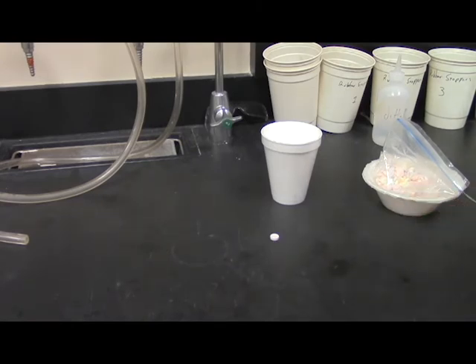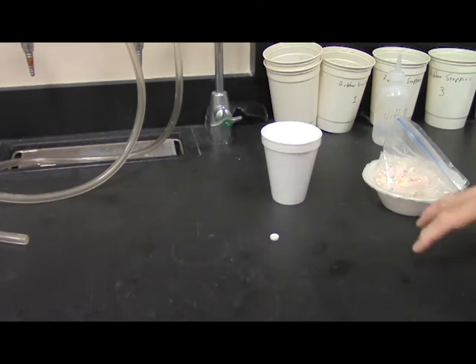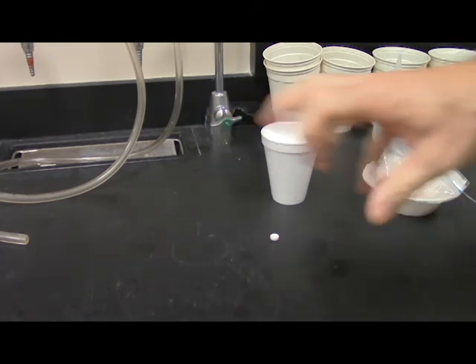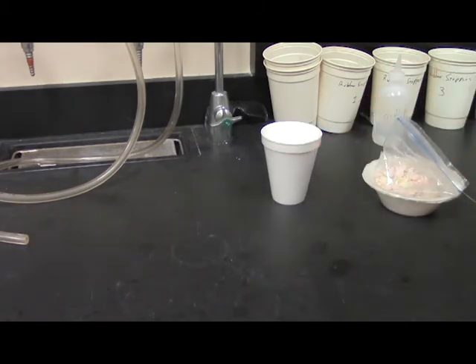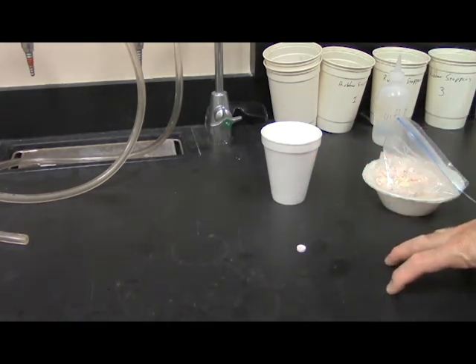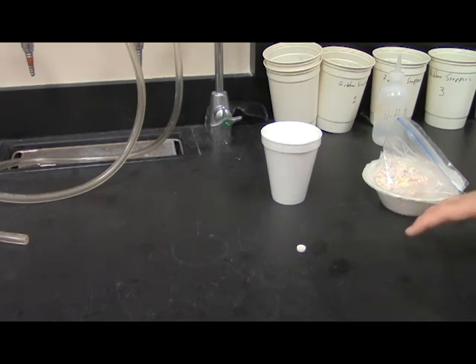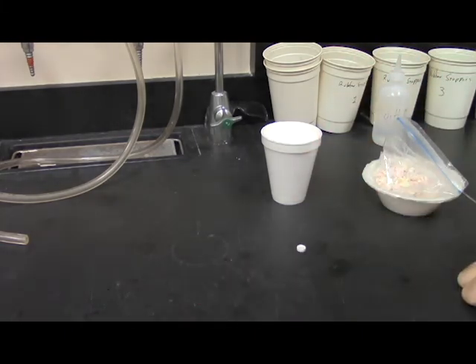And I know what you're thinking. I know what this means. There really were 340 Smarties laid out here, not the 339 that I had originally shown. Do you also realize that means the calculation of the 340 Smarties by mass was exactly correct? I know what you're thinking is, this guy is really good, and it's true. It's just this sucker got away from me. So there it is. So we really did have 340 Smarties. So let's put this thing in its proper spot.